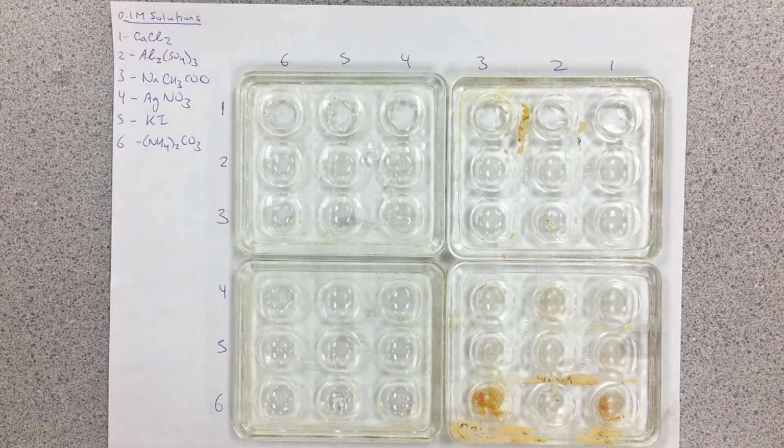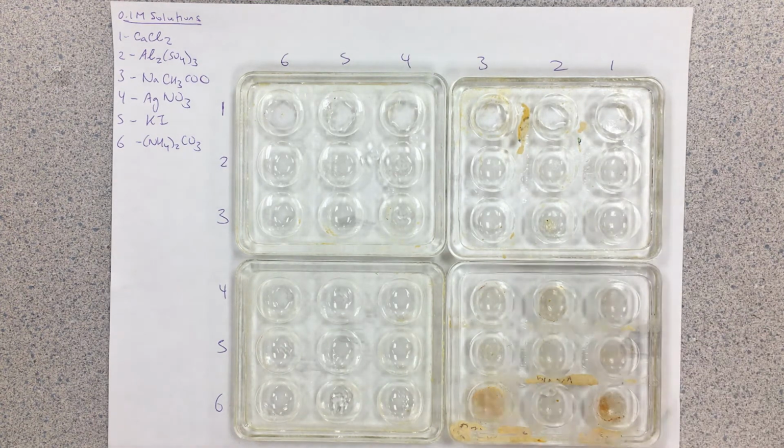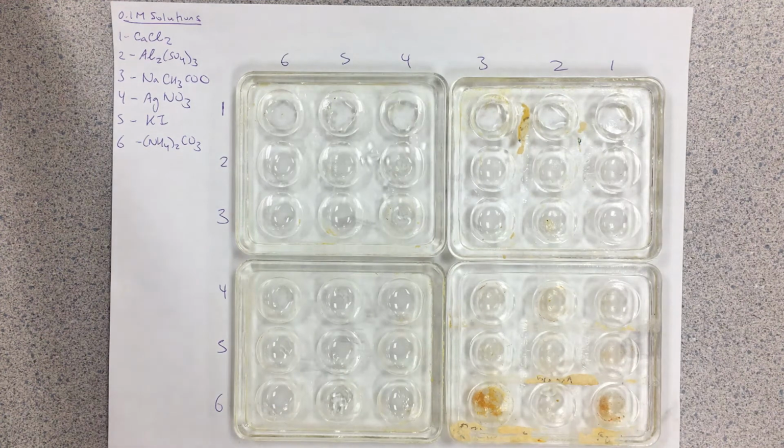We are going to sort of duplicate some of our combinations, so I don't necessarily need to go down this row as well. So you're going to see on the lab handout here, basically we can stop at this dividing line here. So that there is solution number 1. I'm going to continue here with solution number 2.